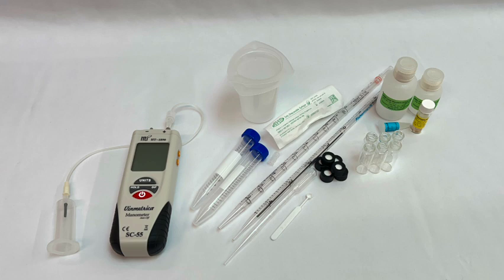This video will solely be demonstrating how to use our kit. For additional information about malic acid or the theory of operation of this test, you can review the information in the manual.